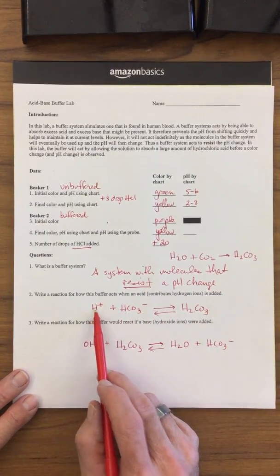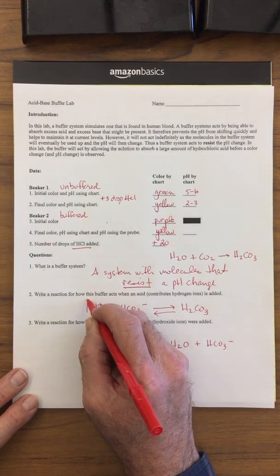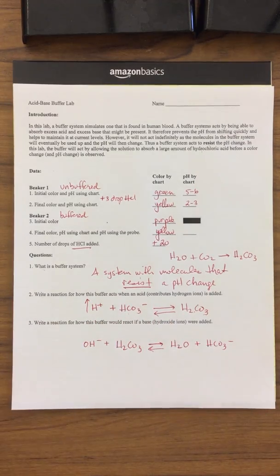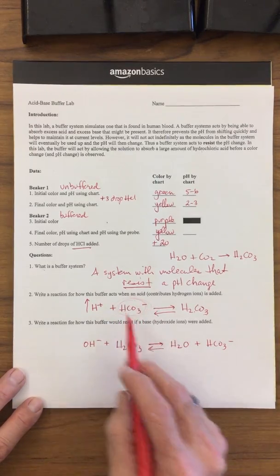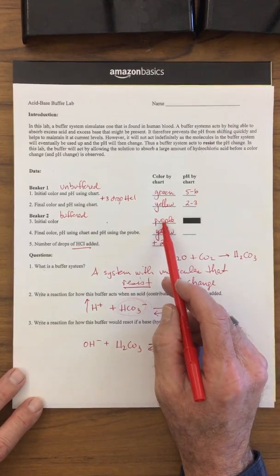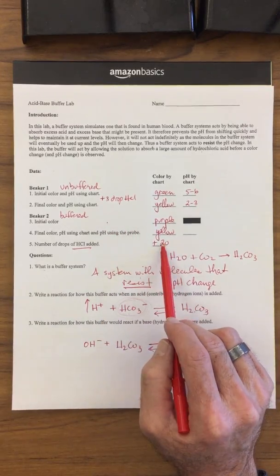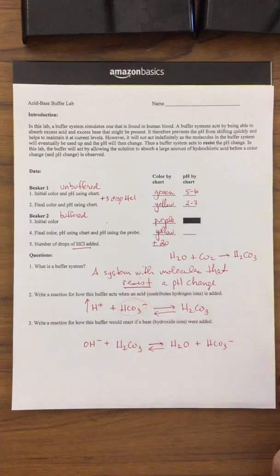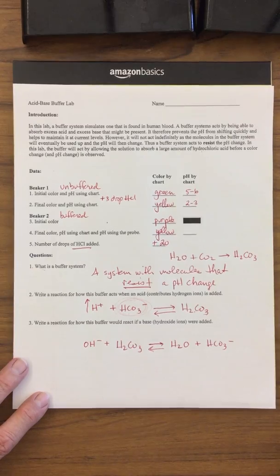However, if we increase the acid, so this is Le Chatelier's principle, for whatever reason, let's say the chemical reactions inside of our body are producing more acids than they should be, well, we have this molecule present inside your blood to absorb that excess acid. Just like the baking soda up here was able to absorb all the excess acid. It took 20 drops to get to the same pH where it took 3 in an unbuffered solution. When your buffer is present, you're able to absorb these extra acids.